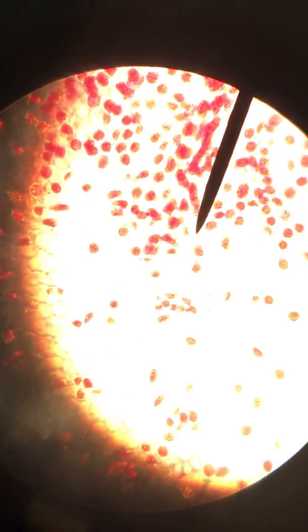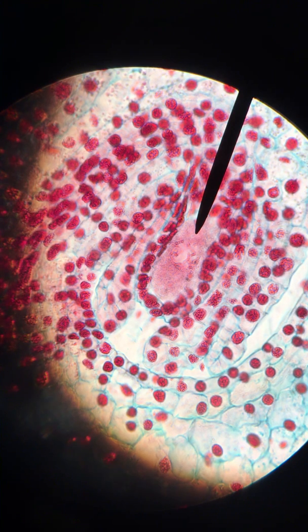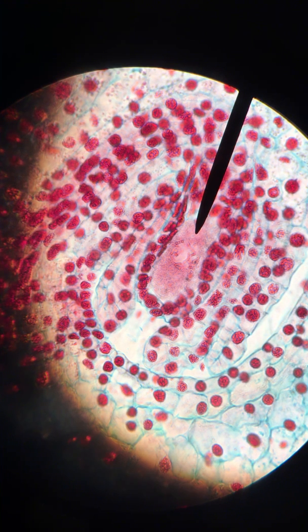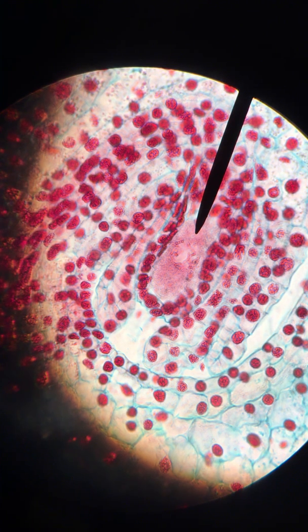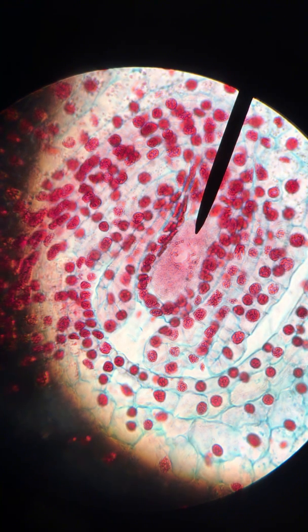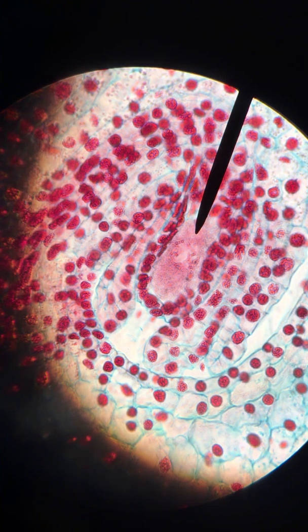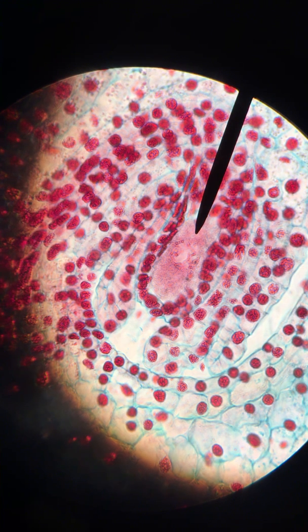I'll go up to about 400x magnification now so that we can see that a little bit clearer. This is our megasporocyte. The megasporocyte is the counterpart to our microsporocyte, which was our male cell that had not yet undergone meiosis. This is the female reproductive cell, which will undergo meiosis to produce our megaspore. Again, this is the megasporocyte, sometimes referred to as a megaspore mother cell.